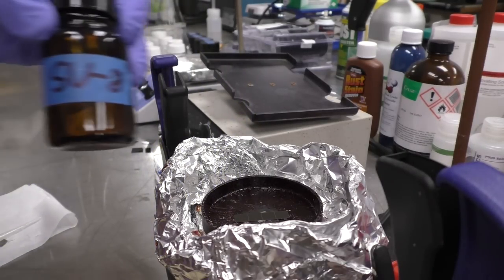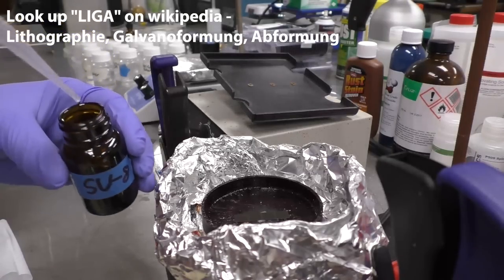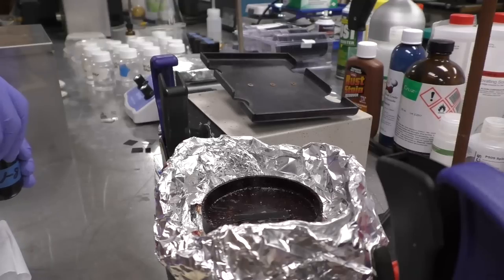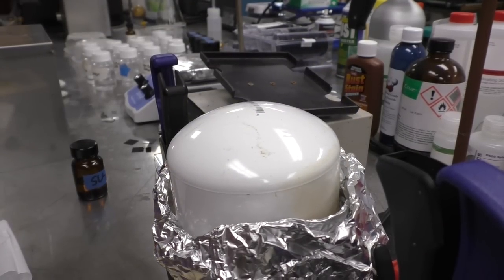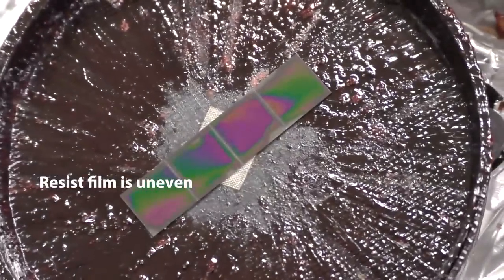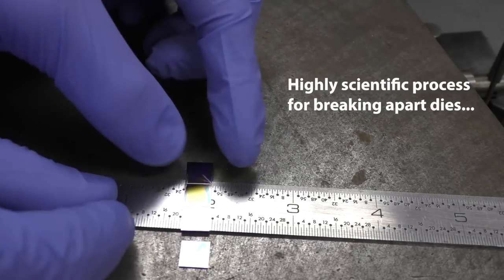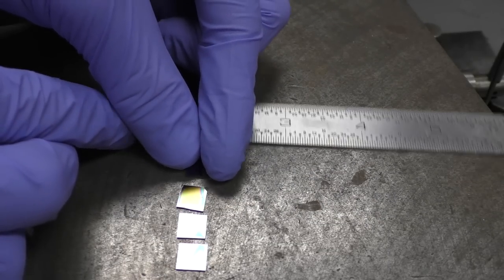I had a little bit of SU-8 laying around, and I heard some stories about it being used in Germany in the 80s, exposed with an x-ray source. So this is a similar wavelength to e-beam, and I said, might as well give it a try. So I put some on the wafer, stuck it in the microscope, and was amazed with the first results. This SU-8 is sensitive to a lot of wavelengths, about 400 nanometers and below as far as UV, and then apparently e-beam as well. I don't have the right developer either, so I exposed it — developed it rather — with acetone, which should never work, but it actually turns out if you swirl it really quickly with acetone, the developing takes one or two seconds, and it's pretty repeatable.